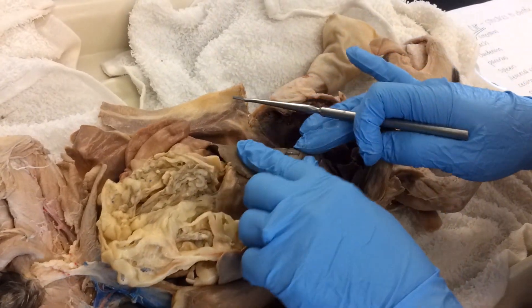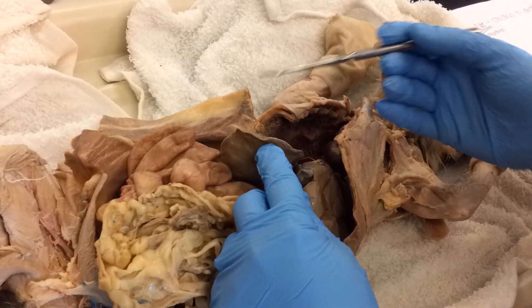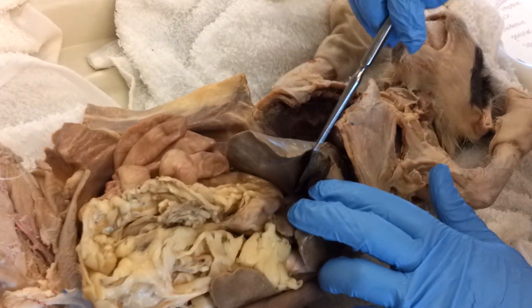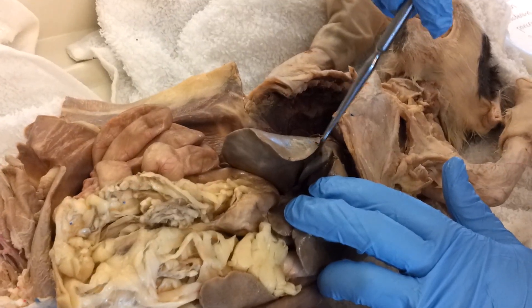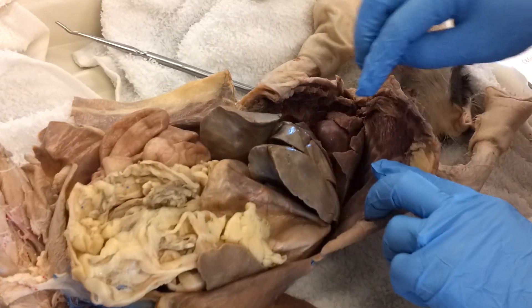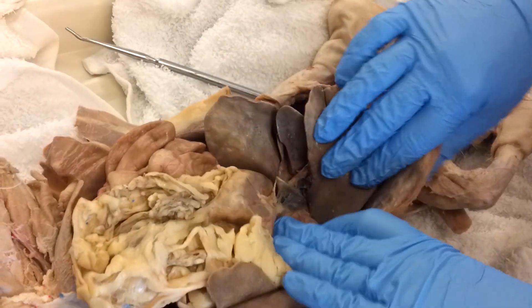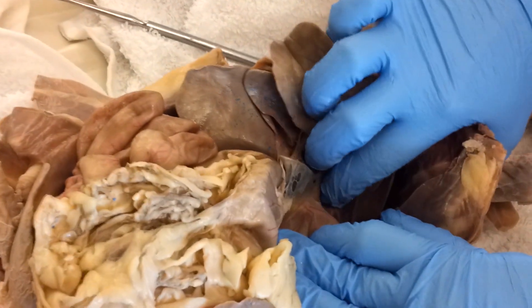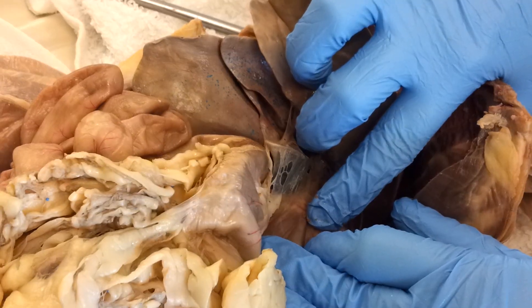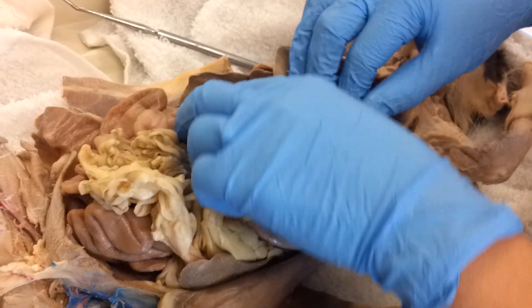The next structure to find is on the underside or somewhere over on the right side of the cat — the gallbladder. You can see that it is a sac that holds bile. The esophagus penetrates through the diaphragm, and you can actually see part of the esophagus right here as it comes to enter the stomach. This is the stomach of this cat right here.